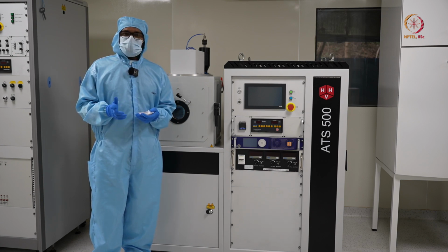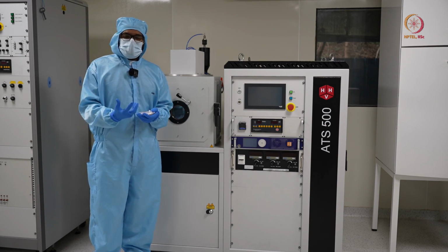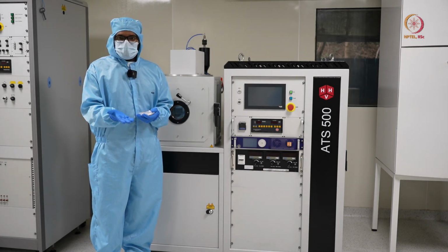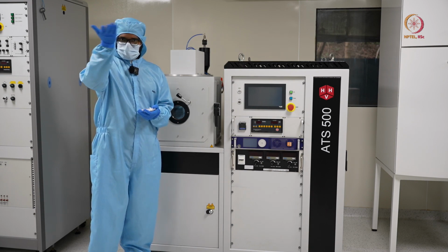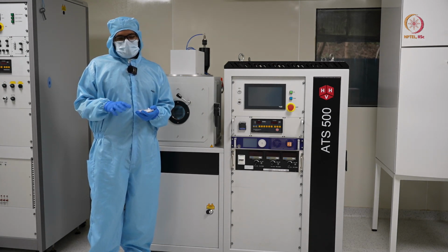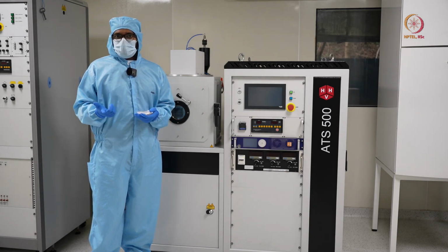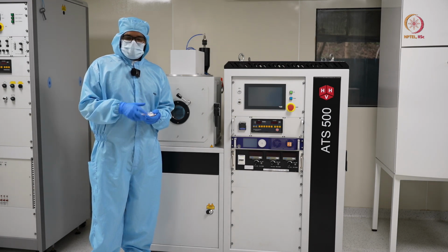For example, with the E-beam, what essentially you do is melt a material, and after melting, the vapors naturally flow and stick to the surface. So you have to melt the material completely. That goes well with metals like aluminium and gold, which have comparatively lower melting points.